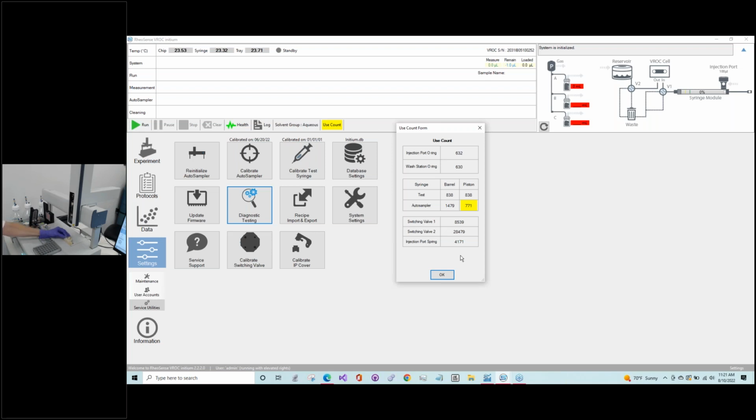Once you take those out, you can pull this out and you can change the O-ring here. So just, again, it's just a matter of pulling it out and then fitting it back onto this adapter here. So that's quite straightforward.